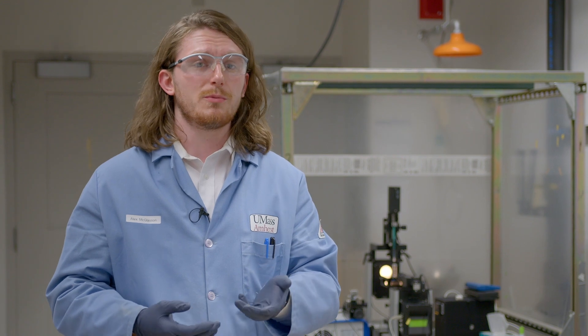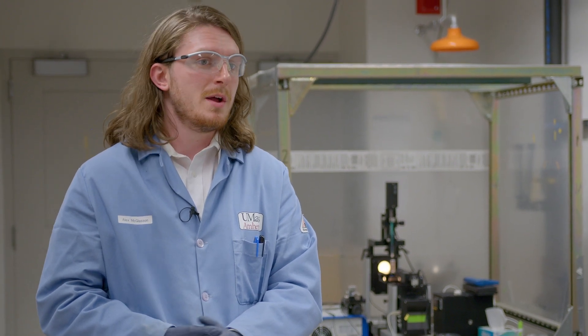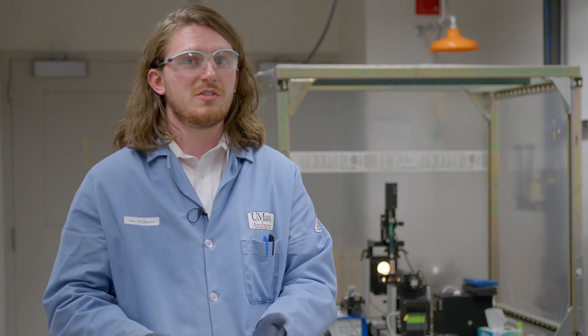This is a characterization method used to probe and determine whether or not different systems will be suitable for various applications. One of which we will showcase now is liquid-liquid 3D printing, which was pioneered by our group. My co-worker Yi Chen will be able to tell you more about this.